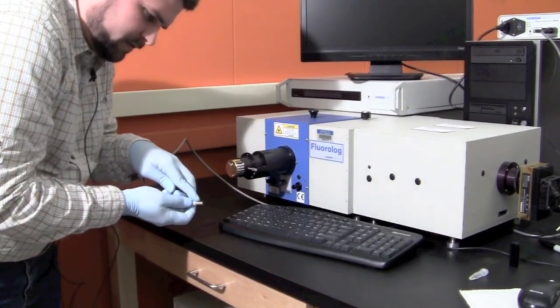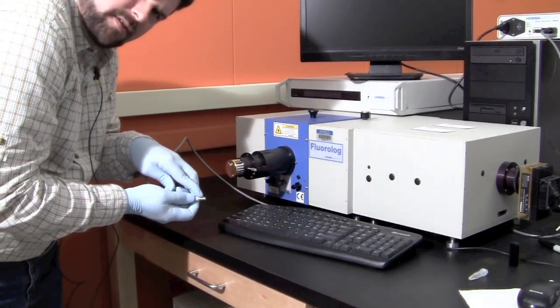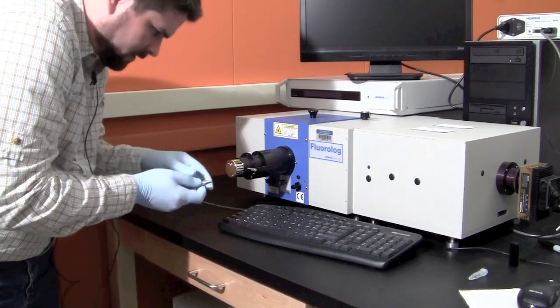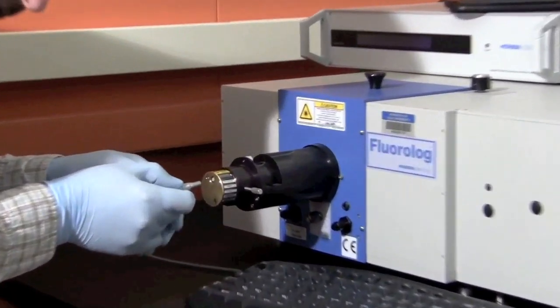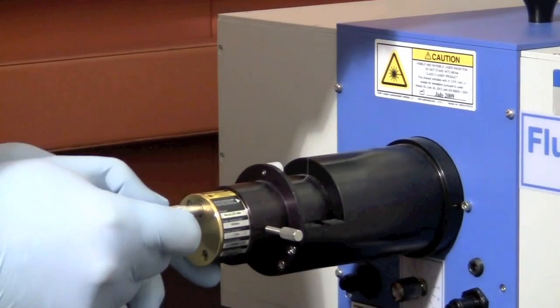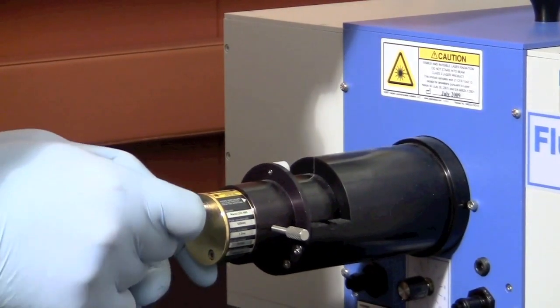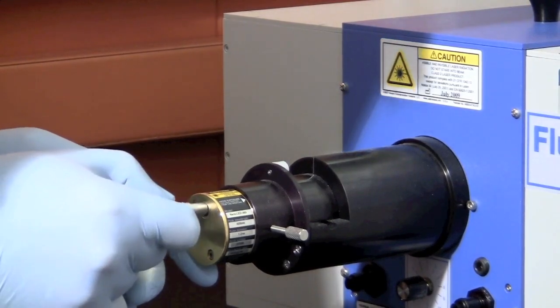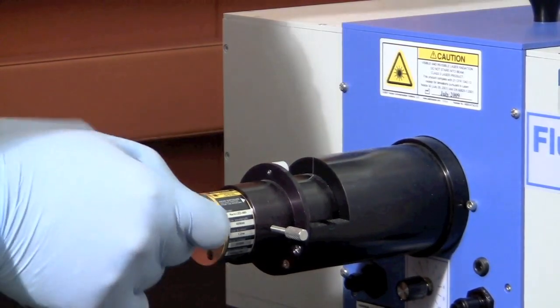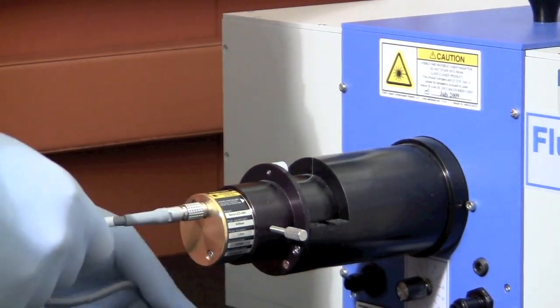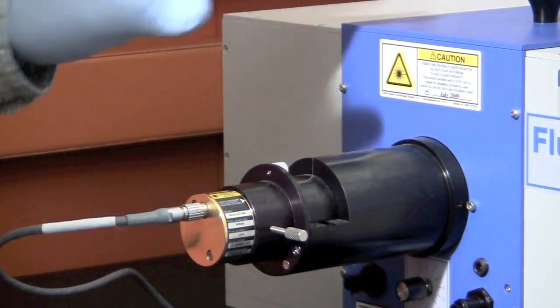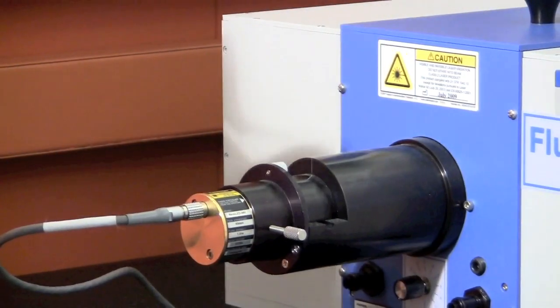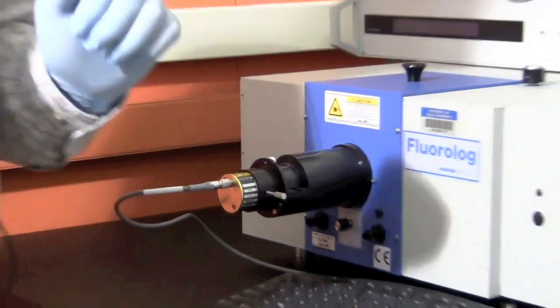There's a little ridge on the plug that needs to line up with the divot inside here. If you plug it in and you don't get light, this is why. Now we have the laser hooked up and can turn everything on and start counting photons.